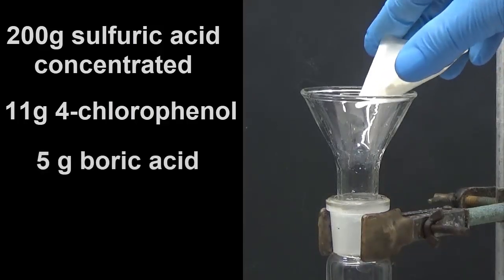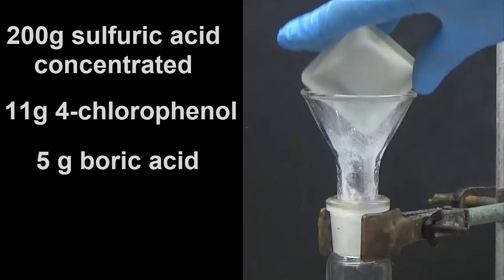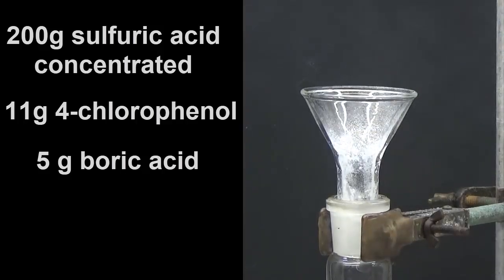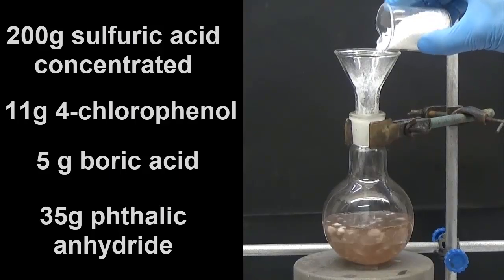Add 5 grams of boric acid and 35 grams of phthalic anhydride.